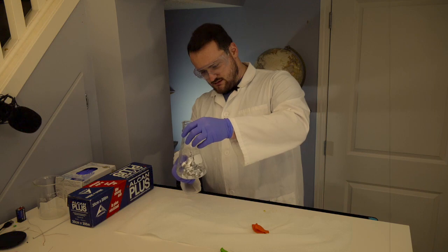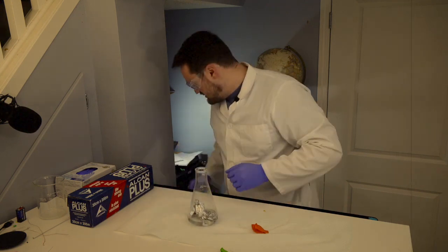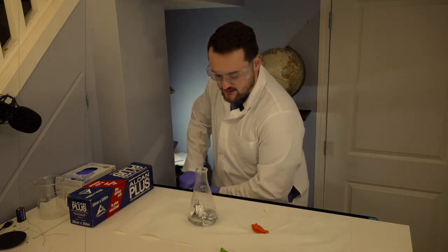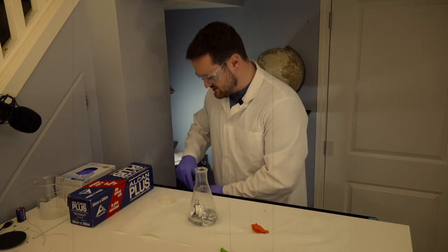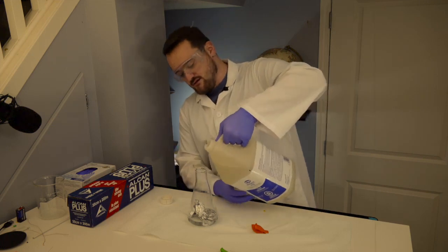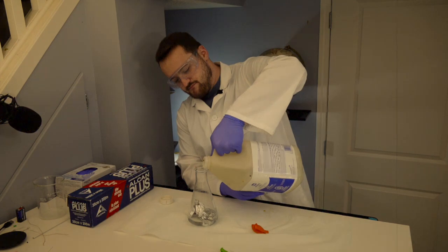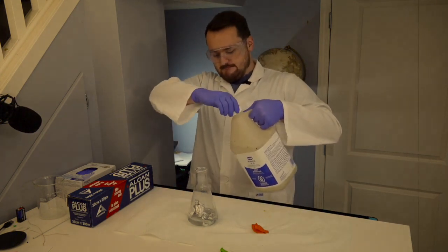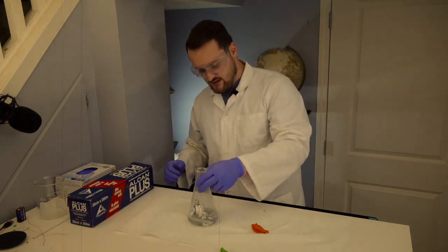And it's not really getting, well, it's kind of getting started. But I'm going to help it along. I probably added a little bit too much water and diluted it a little bit too much. So it's just gonna be slow. So I'll just add a little bit more hydrochloric acid and that'll just kick things off. There we go.